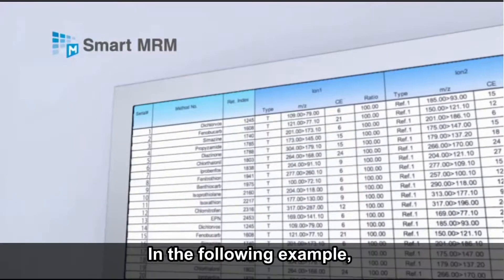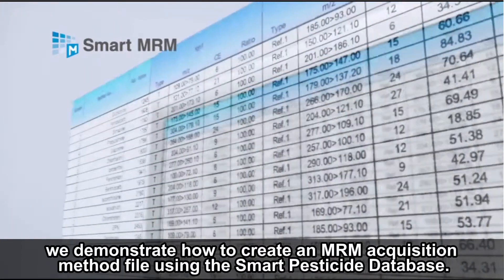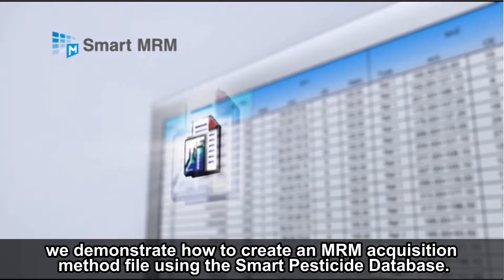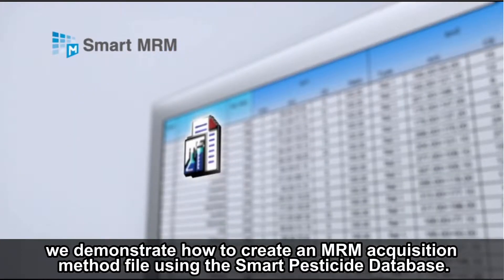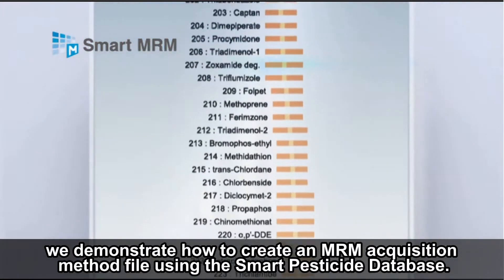In the following example, we demonstrate how to create an MRM acquisition method file using the Smart Pesticide Database.